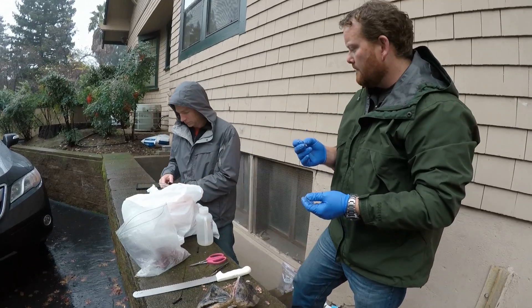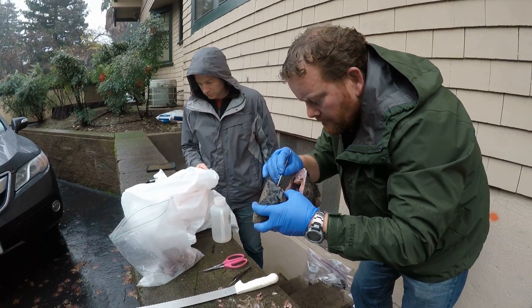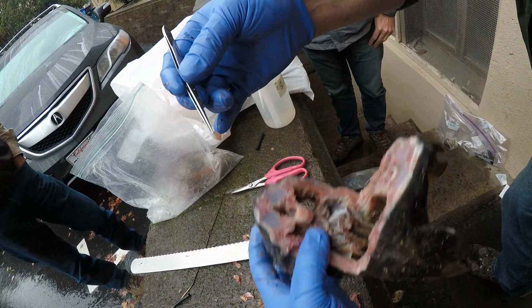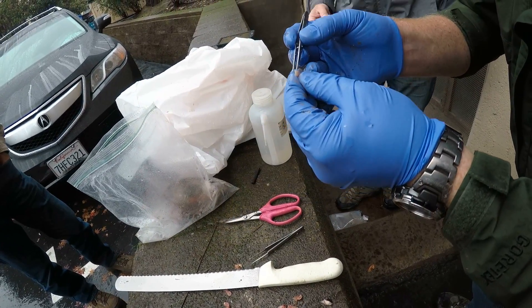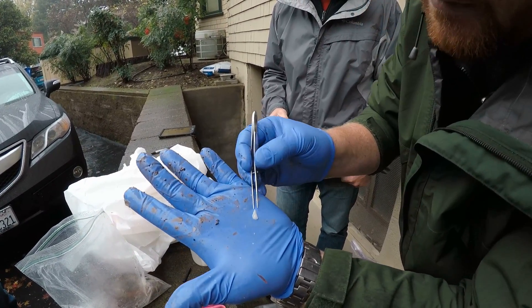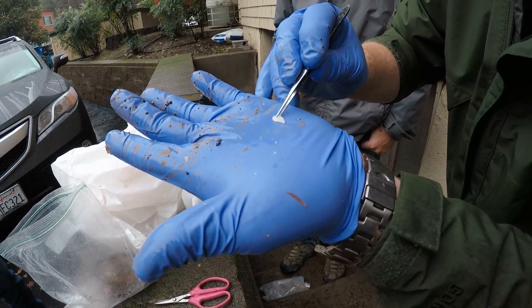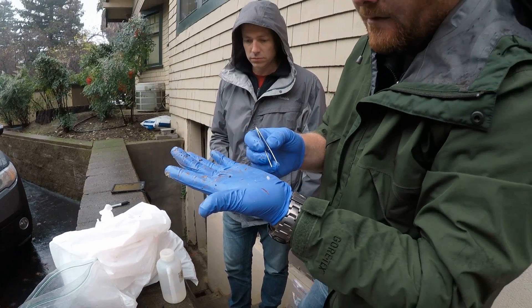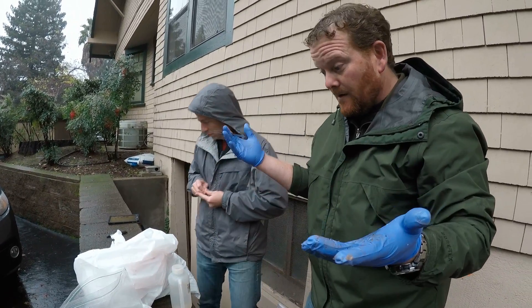What we do is we take that otolith and put it in a vial, then grab the other one. You can see that this is an operation that you cannot do on a live fish — that's why we need to find carcasses. It's nice that they donate their bodies to science. You can see a ridge running down the middle of it. We work with some researchers from UC Davis — they'll cut it in half and use a very sophisticated instrument that measures the concentration of that strontium versus calcium ratio, and tell us where the fish was born.